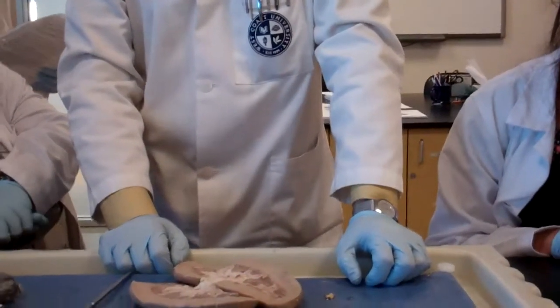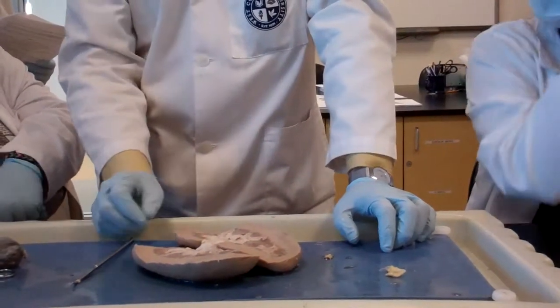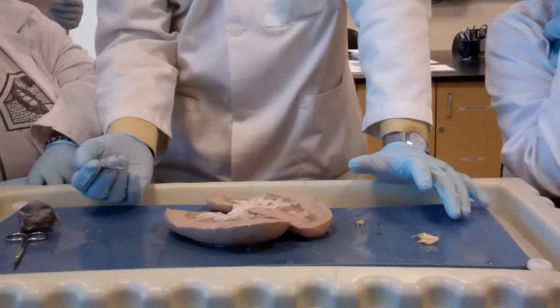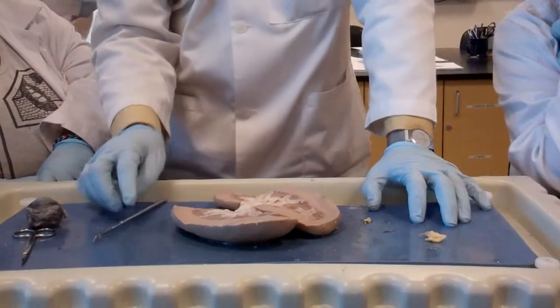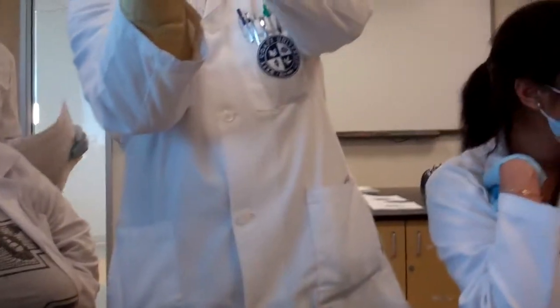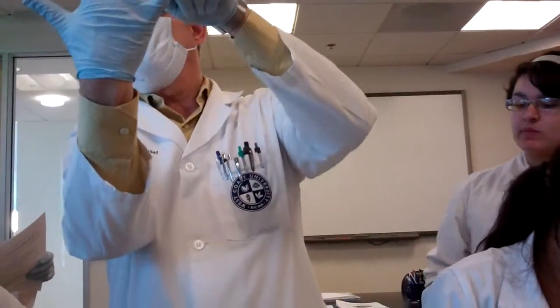So two minors make one major? Not necessarily. It depends on the shape, and each kidney size is different. But that's the concept. When you look at them, it's like branches. This is a minor, this is a minor, this is a minor, this is a minor, and this whole thing is a major.